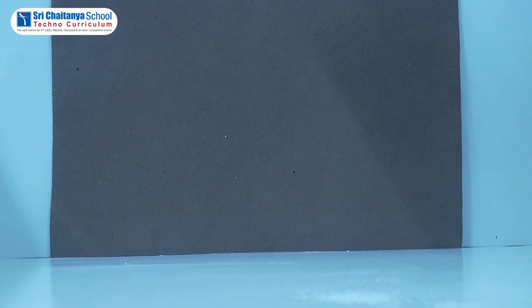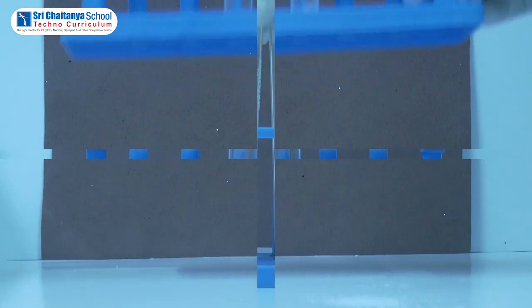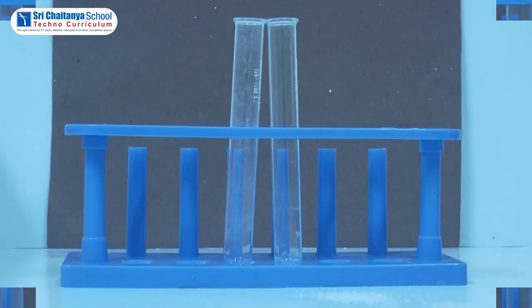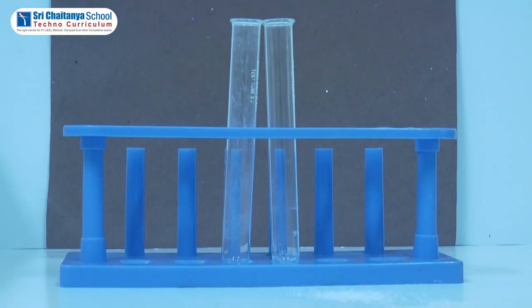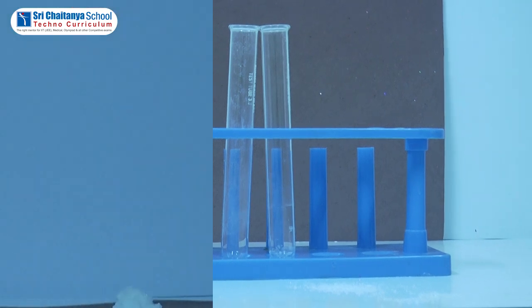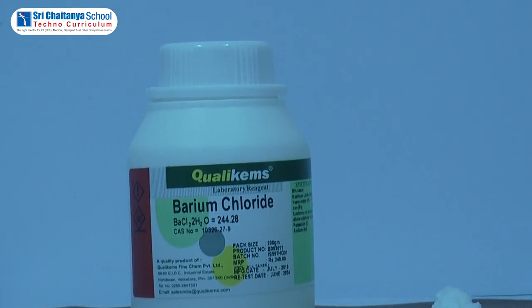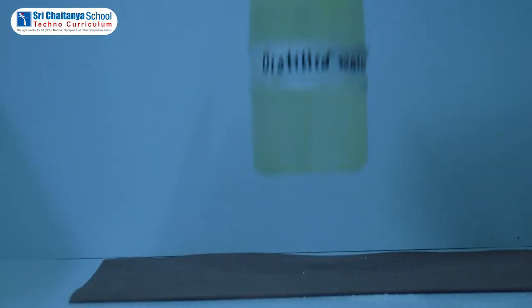The materials that are required: two test tubes, sodium sulfate, barium chloride, and distilled water.